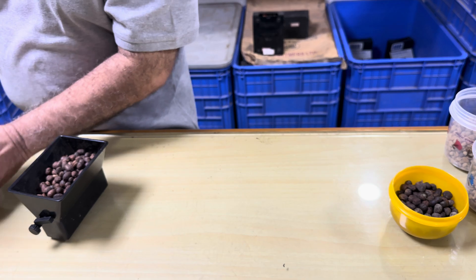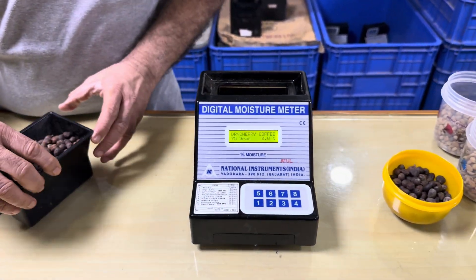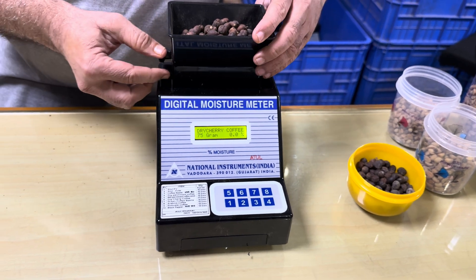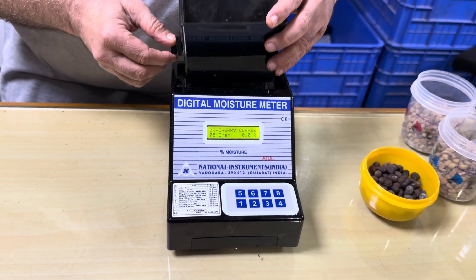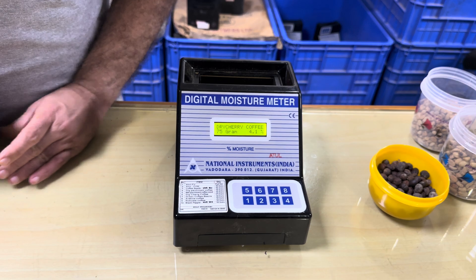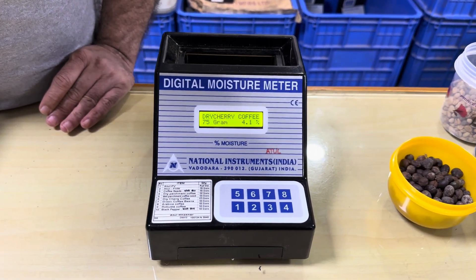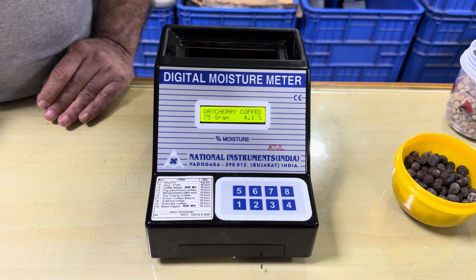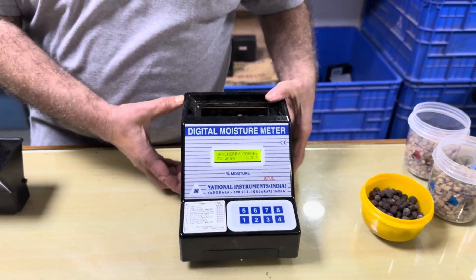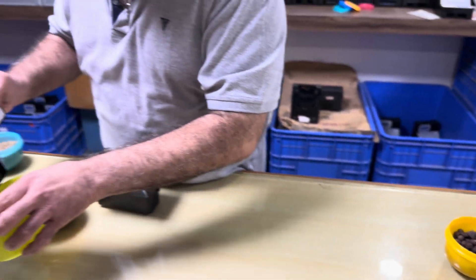To demonstrate cherry moisture in another sample — here you can see this is a very dry cherry, it is showing 4.1% moisture. You have to take 75 grams to measure the moisture contained in dry cherry.